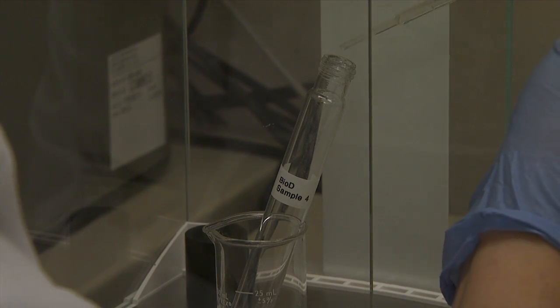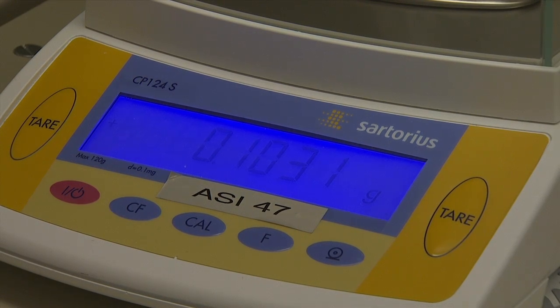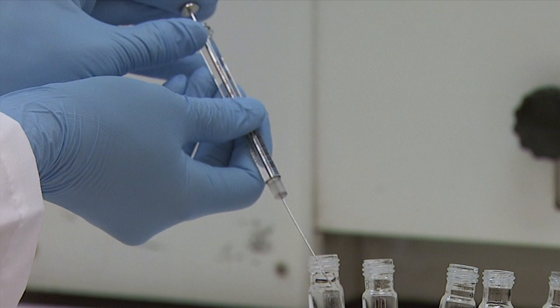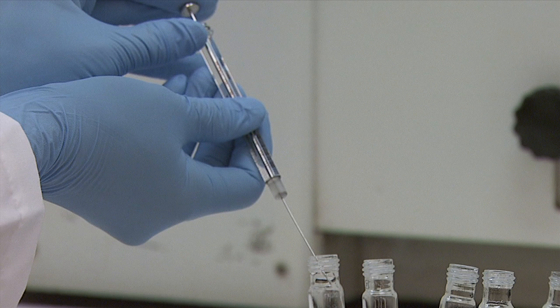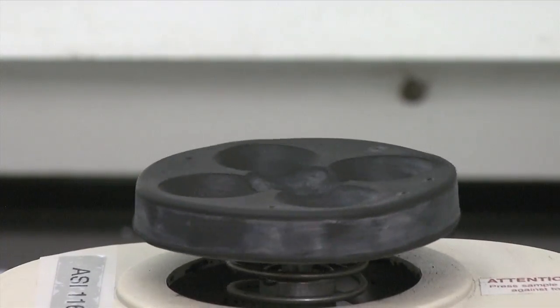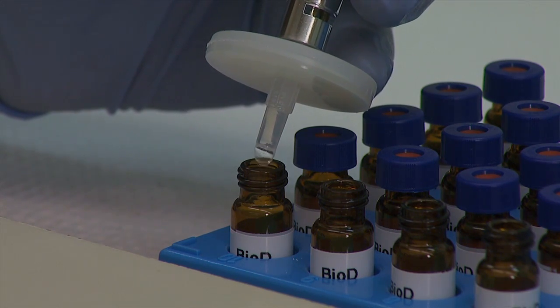To prepare the samples, weigh to the nearest 0.1 milligram approximately 100 milligrams of sample directly into a 10 to 15 milliliter vial. Using microliter syringes, add exactly 100 microliters of each internal standard and the derivatization reagent MSTFA. Vortex or vigorously shake the vials and allow to stand at room temperature for 20 minutes. Add 8 milliliters of normal heptane to each vial and vortex or shake vigorously.